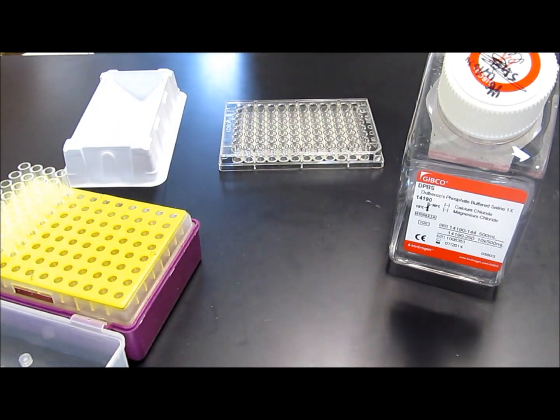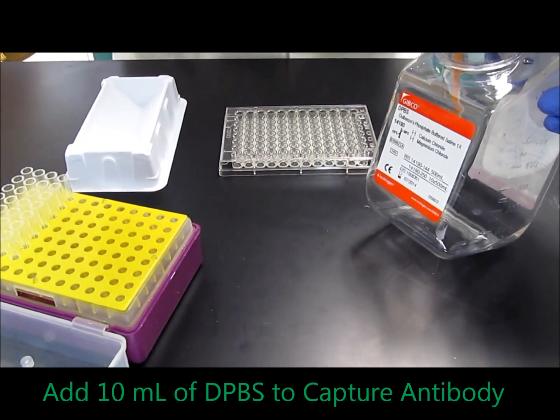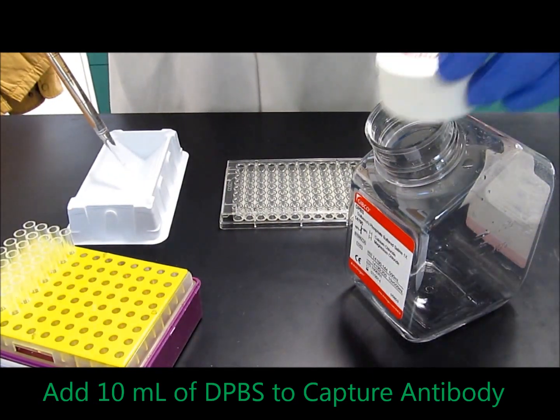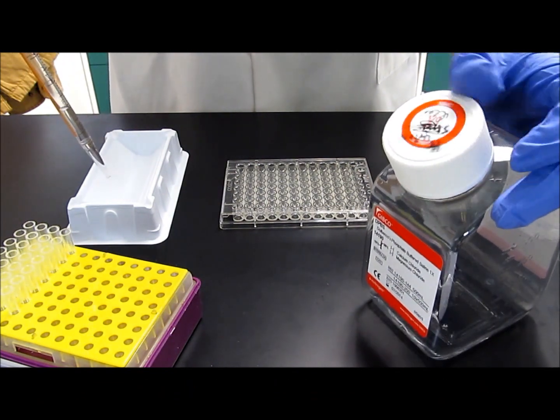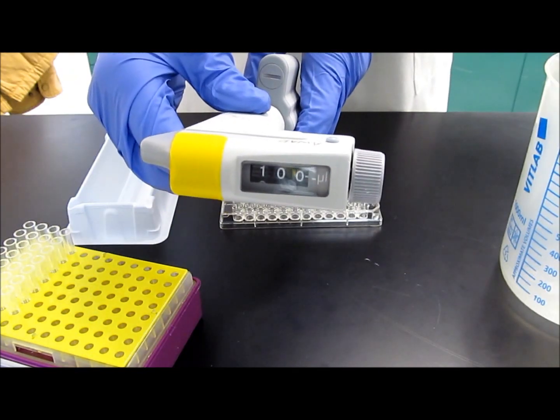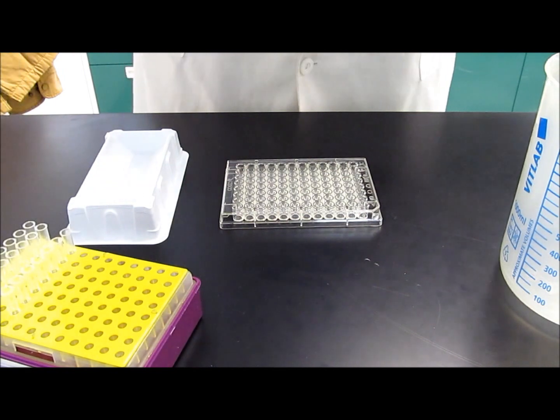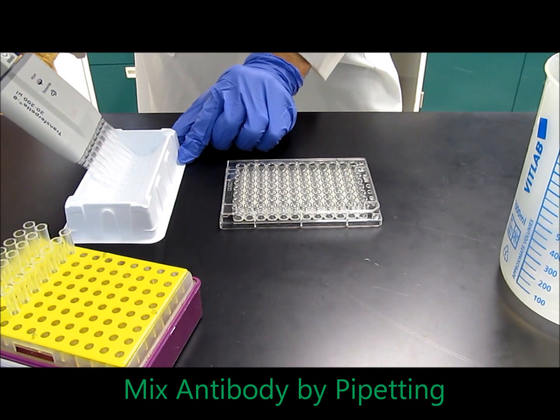For the next step, you're going to add 10 milliliters of DPBS to the reagent reservoir. It's important to note that you dilute capture antibody in DPBS because you're trying to maximize binding to the ELISA plate. After you've diluted the capture antibody in PBS, set your micropipetter to 100 microliters and pipette back and forth to mix the capture antibody thoroughly.